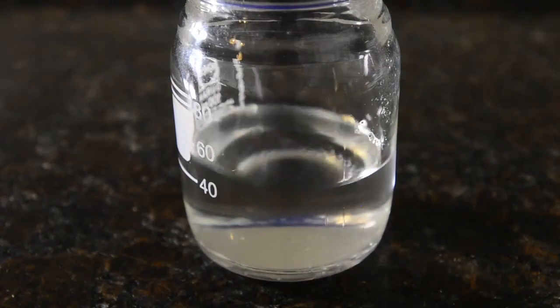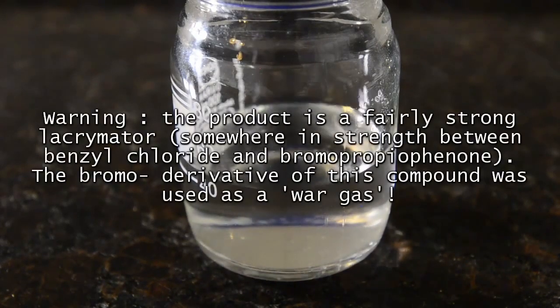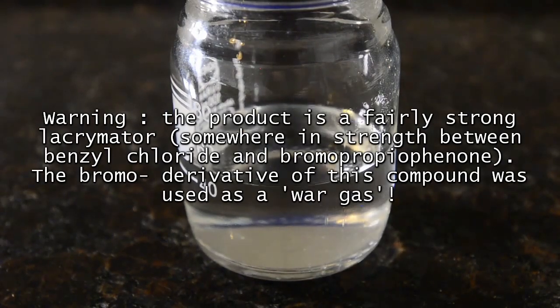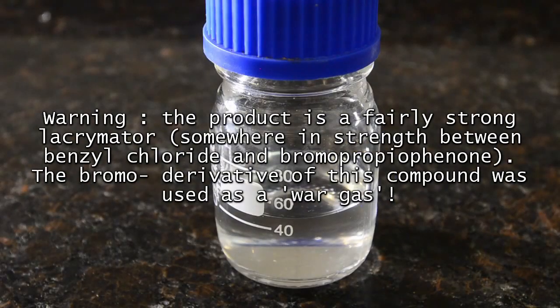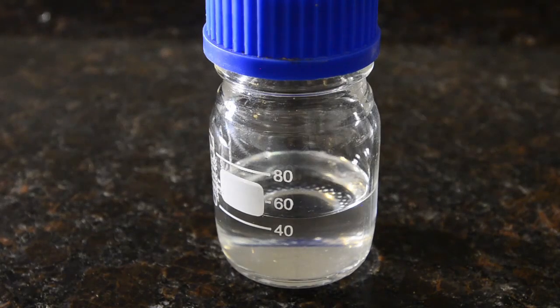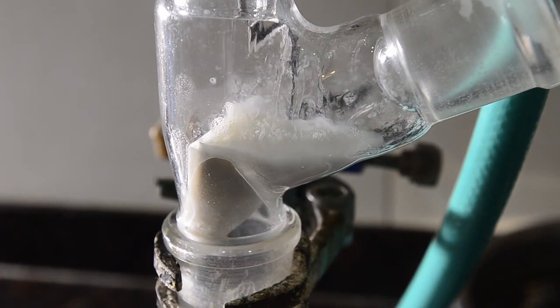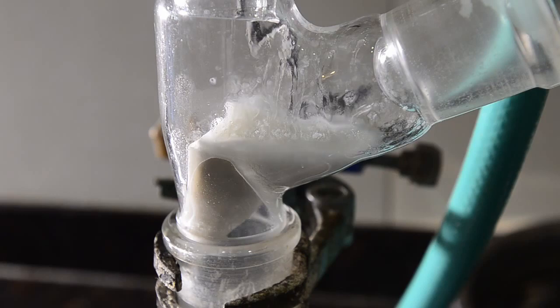Be careful with the product. It's not as bad as bromoacetone or bromopropiophenone, but it's lachrymatory and worse than benzyl chloride in that respect. There may be a way to use calcium oxide to make esterification more efficient, but it's going to require some more specialized equipment, and also having the oxide in solid granule form so it doesn't wash over. We'll let you know if we get anywhere improving this.